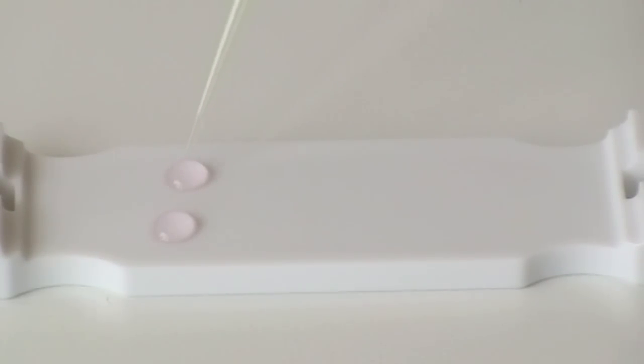In the case shown here, 30 microliters drops are being applied. For this size drop, there is room for at least 8 drops on the casting area.